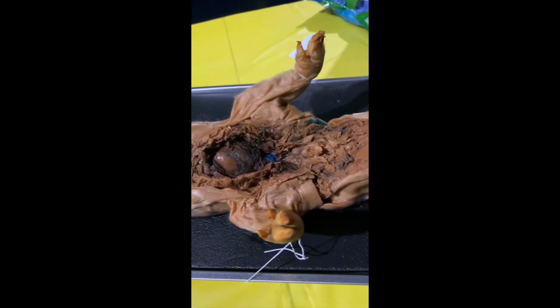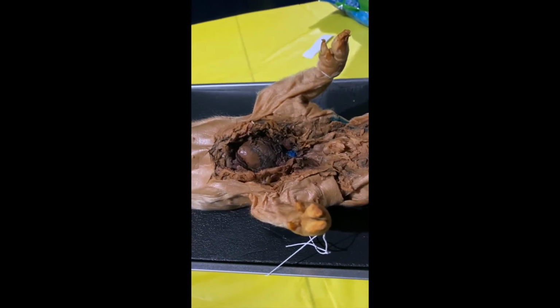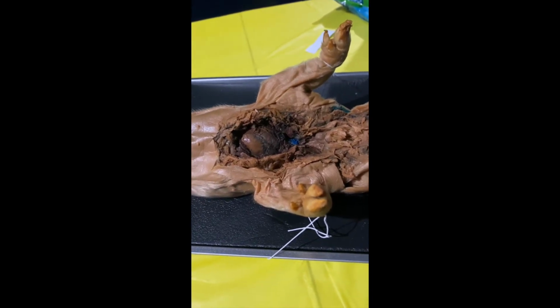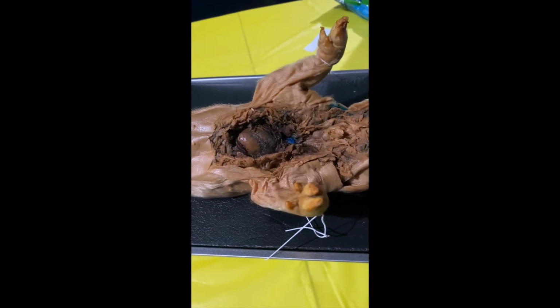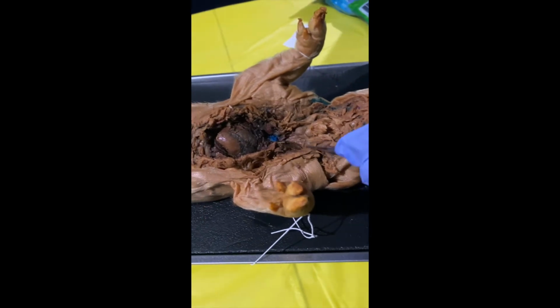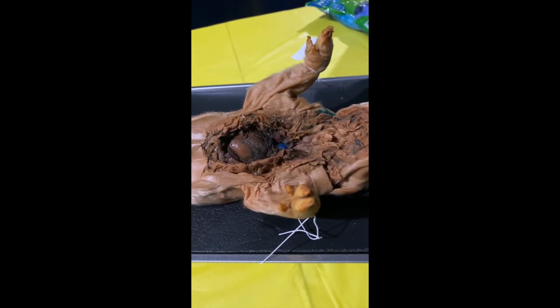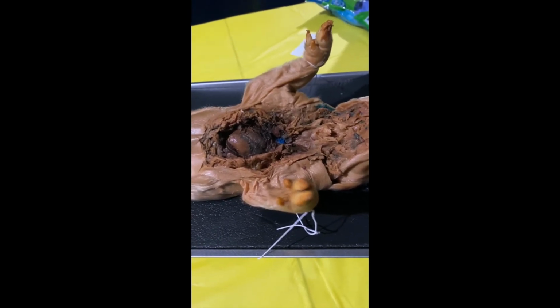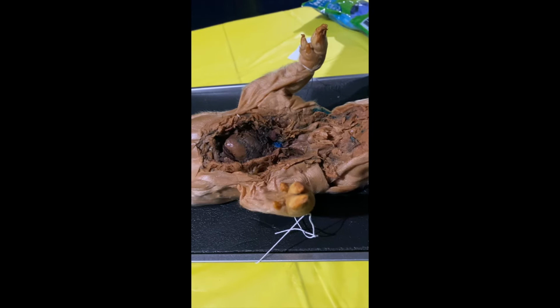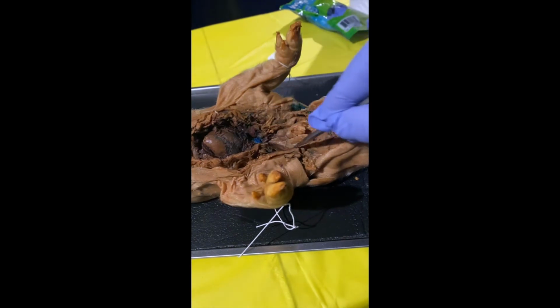Okay, so we're going to start with what's called the external jugular vein. The purpose of the external jugular vein is that it drains blood from the head, the brain, the face, and the neck in humans, and it sends it towards the heart. Now, the external jugular vein should be right around here on this pig. Now, the internal jugular vein, it's a major blood vessel, again, that drains blood from the face, brain, and the neck, and there normally is, or there should be, an internal jugular vein here and right around there.